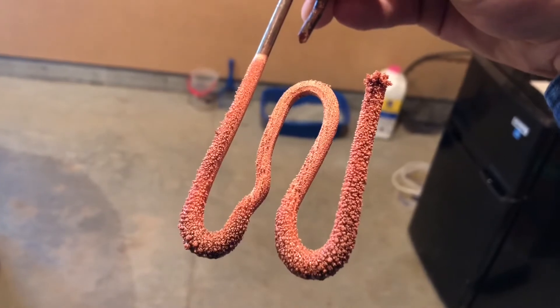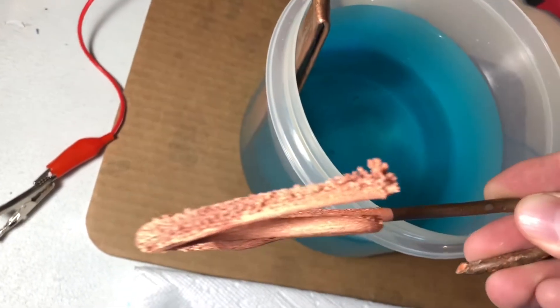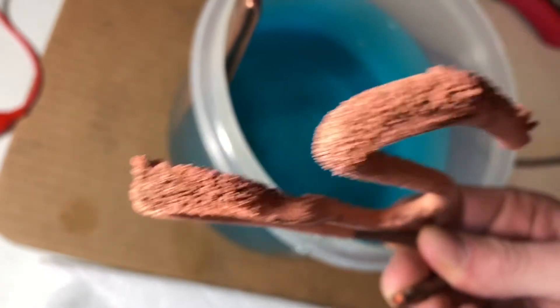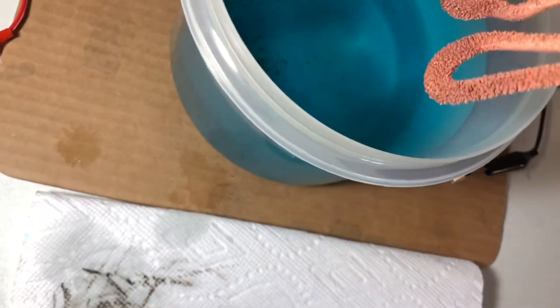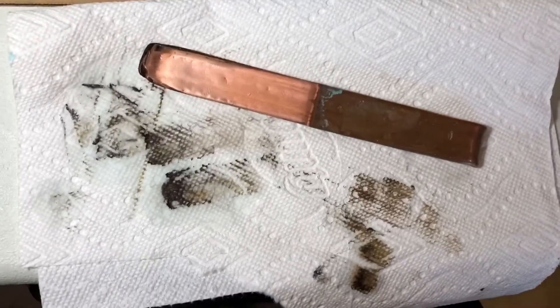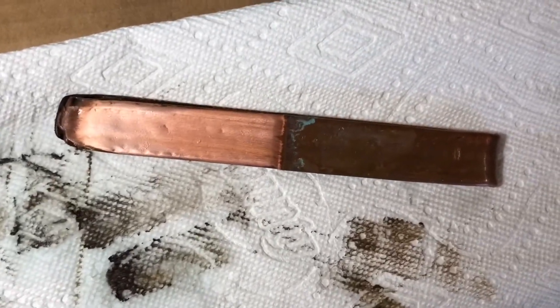Starting to look pretty cool. Here it is in some better sunlight. You can see how thick they are — there's a bunch of crystals down here too. You can see that the copper is getting eaten all the way through in spots along that crack there, it's getting quite thin. This will be interesting to see what it looks like after another week or so. I'll get a family member to lower it in further to keep the crystals growing while I'm gone.